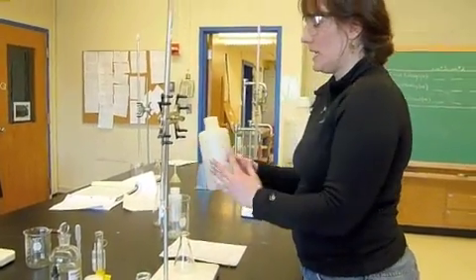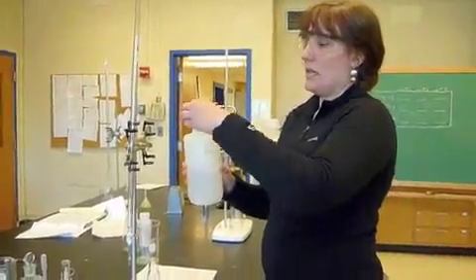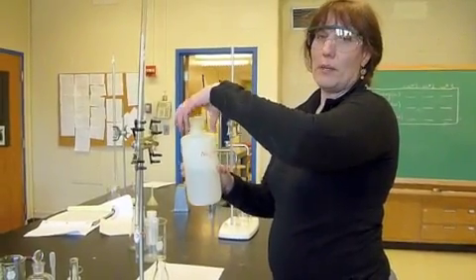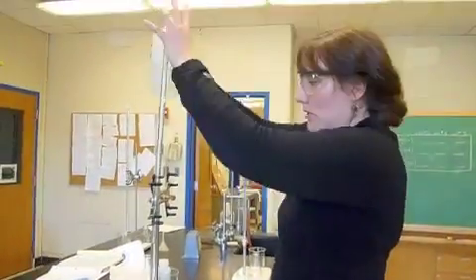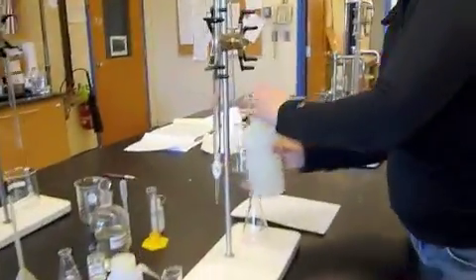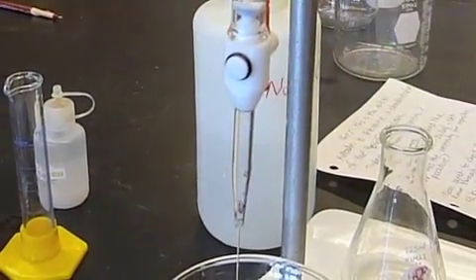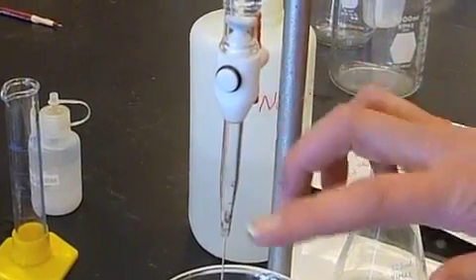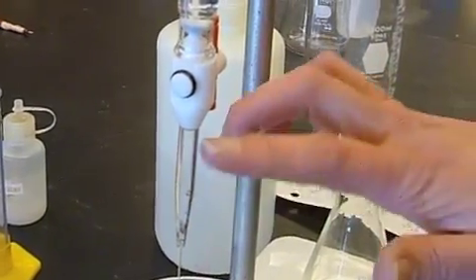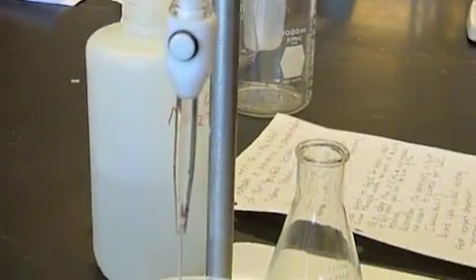We are going to take our solution and we're going to run a little bit through it. I just want to clean it out, basically. We're going to run it through and make sure it just gets all the water that might be down in the bottom of the stopcock.